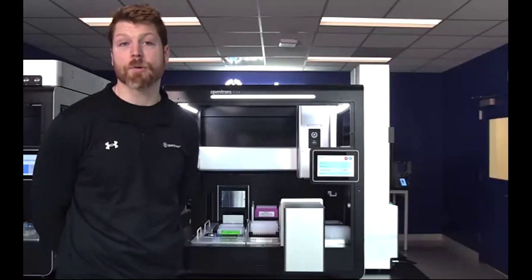So in a high throughput setting, such as 96 samples of library prep, including library prep protocols that are more tip intensive, such as ones with enrichment, the stackers can be used to add additional tips and labware to greatly extend your walkaway time.